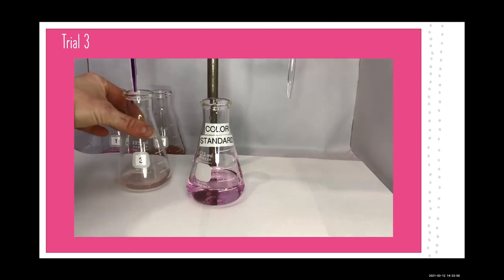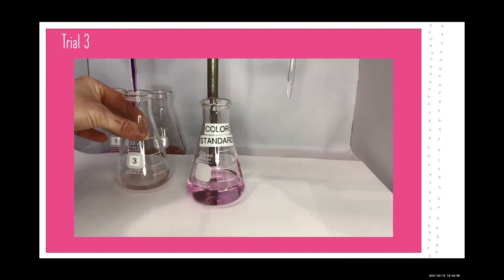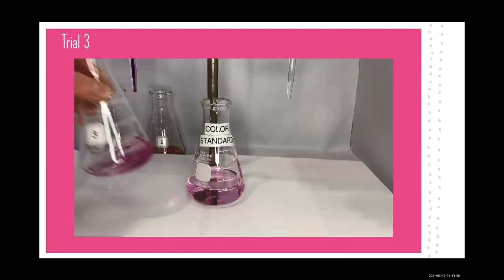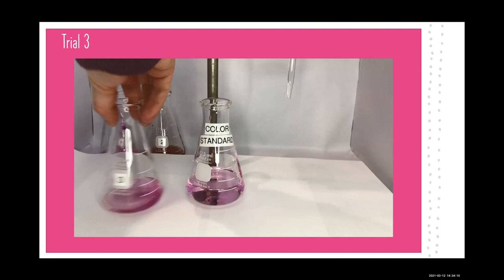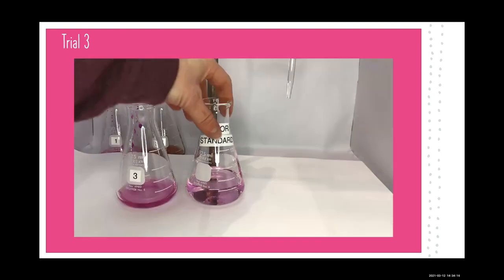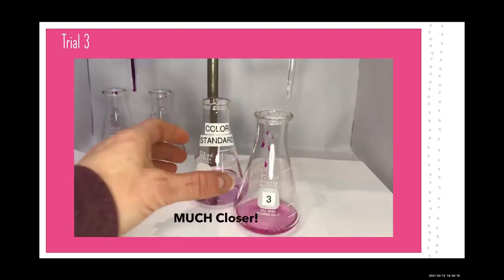And right about there, it's starting to change. And so I wanted to see if I could get one more drop, because that's a little undershot. That would have been perfect, but as you see, when I pull it away, I get one more on the side, and it runs down, and then it gets a bit darker. But right before that drop drizzled down the side, it was about spot on. So this was much closer.